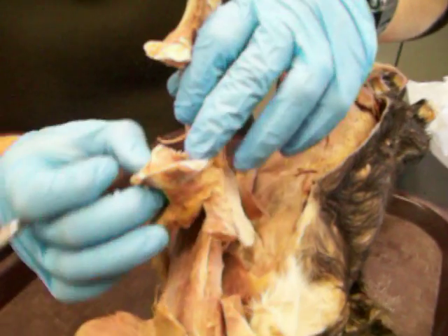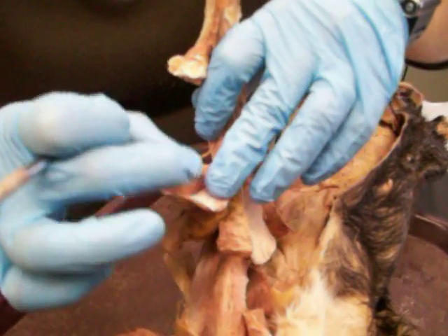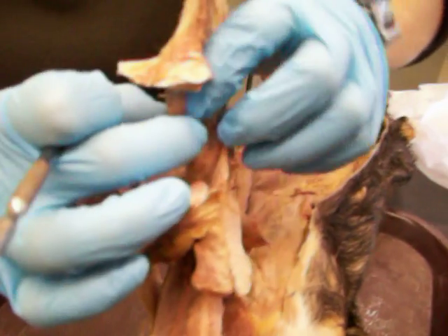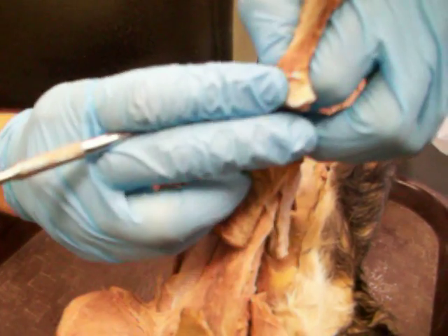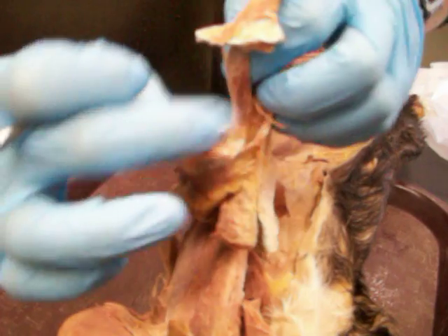As far as the bottom of the leg is concerned, here's the gastrocnemius with the plantaris in between, and the soleus right there. The three of them come together to form the Achilles tendon and the calf muscle. So: gastrocnemius, plantaris, soleus.